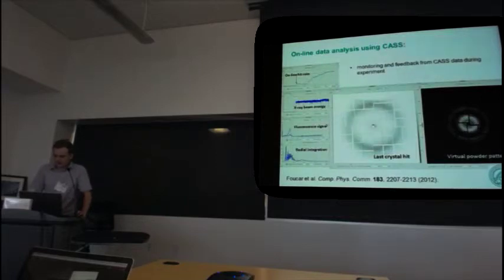So here is what the online data analysis using CASS looks like. And here we have the graph of the online hit rate, which grows with time whenever we are on the jet and have enough crystal concentration. We can also monitor the X-ray beam energy and the fluorescence signal, or calculate the radial distribution of intensities of this virtual powder pattern. And also we can look up the last crystal hit, which is very useful.